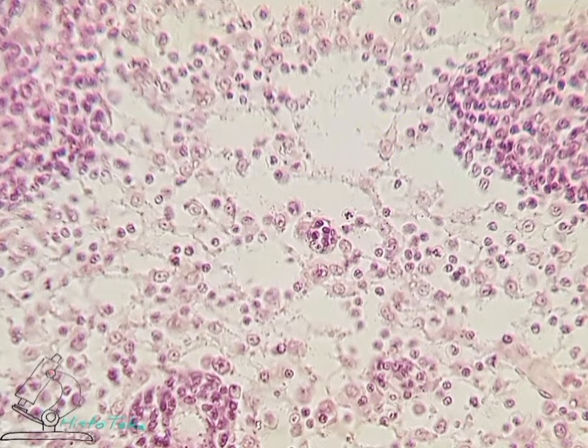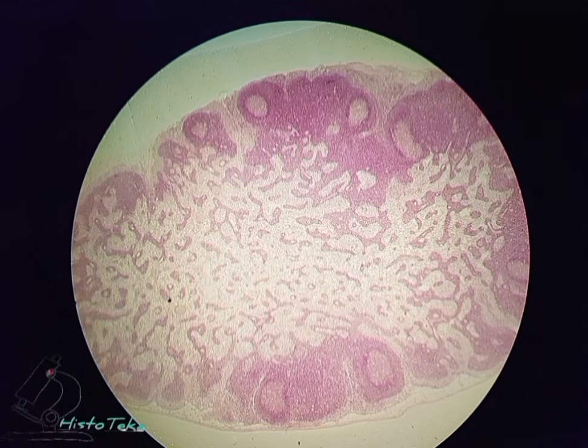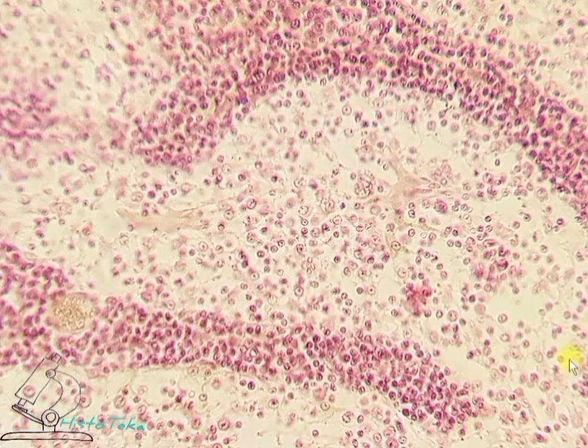Another characteristic feature of reticular tissue is the presence of reticular fibers, but they are not detected when stained with hematoxylin and eosin. So briefly, on this preparation it is necessary to determine the lymph node itself, identify the medulla in it, and in the sinuses of the medulla reticular cells and lymphocytes can be determined at high magnification.